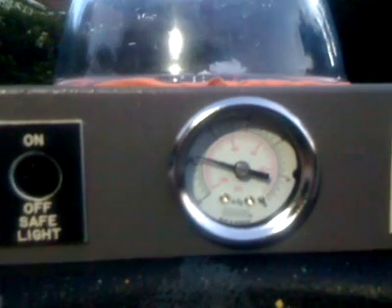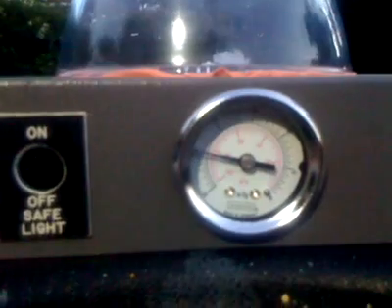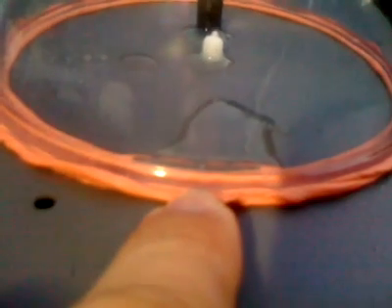And what else have we got? We've got minus 25 inches. And a little bit of water I had inside, I don't think there's anything going on with that yet. I don't see any bubbles. The only bubbles were from air leaking in initially. But nothing boiling, which is what we're interested in.